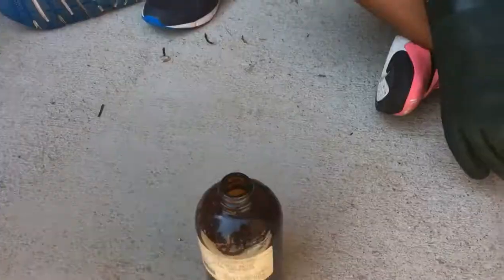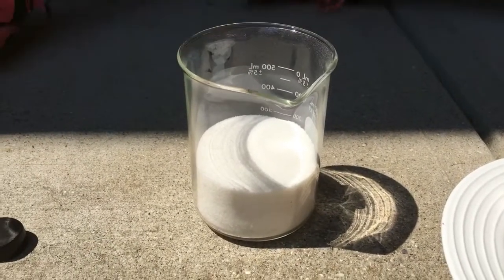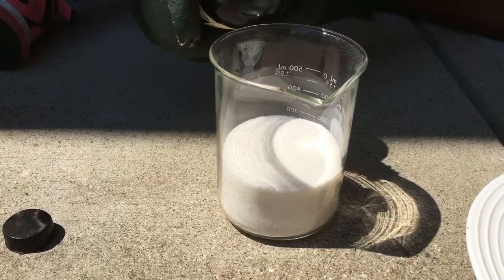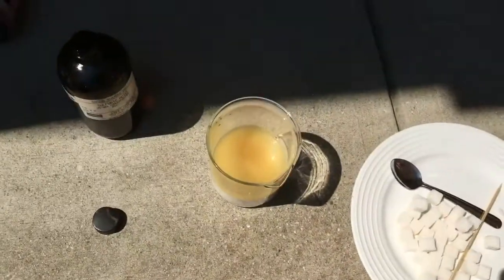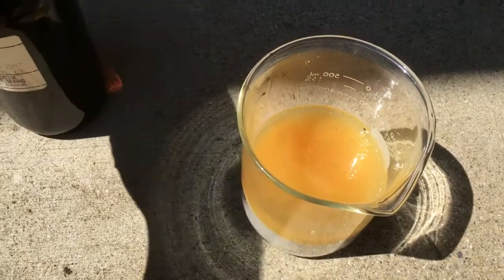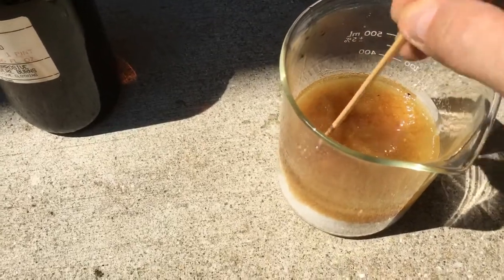And Jada, you have gloves on, don't you? Mm-hmm. So I want you to go ahead and pour some acid into that beaker until it reaches the level of the sugar. Go ahead. And right now, that's good, stop. We know that the sugar there has the potential to move, but it isn't yet. It's not moving yet. So what we're going to do is take our shish kebab stick here and stir it up.